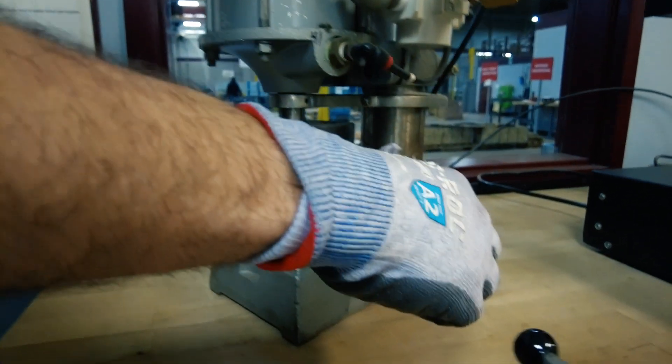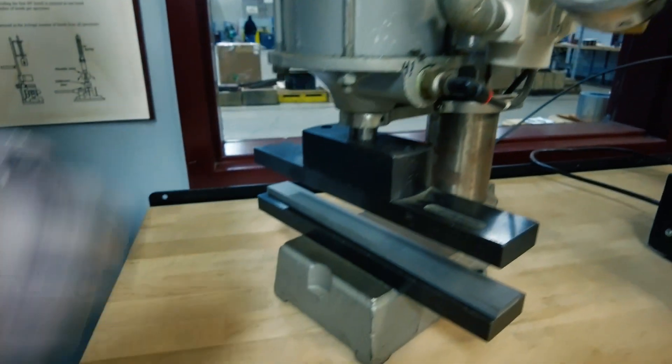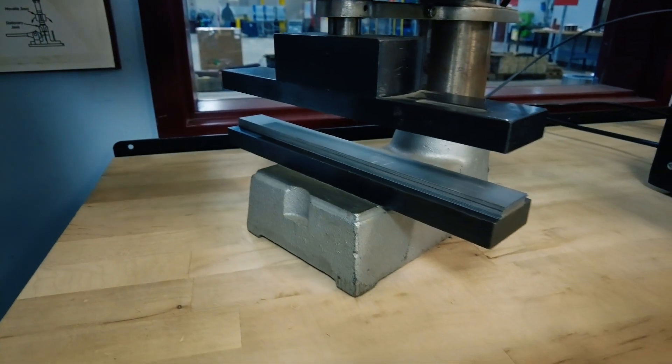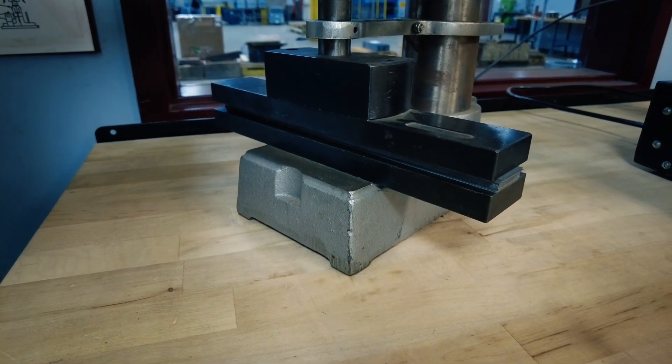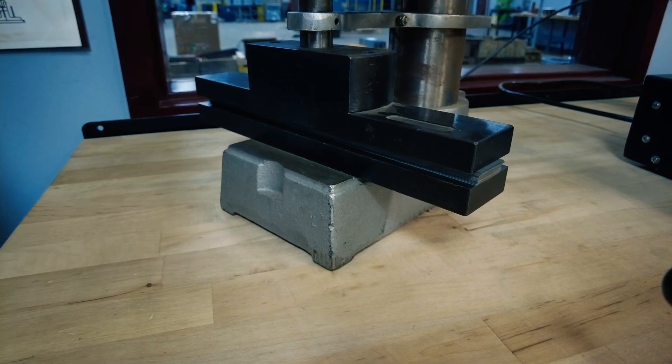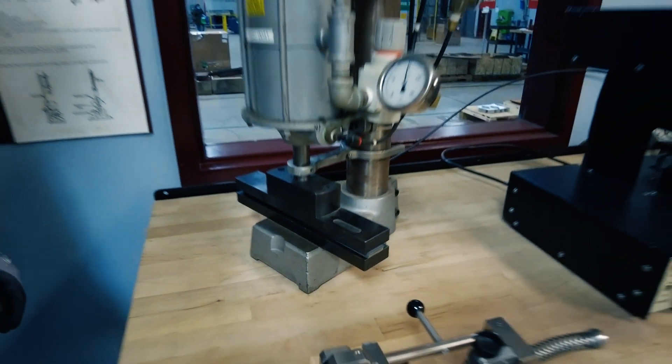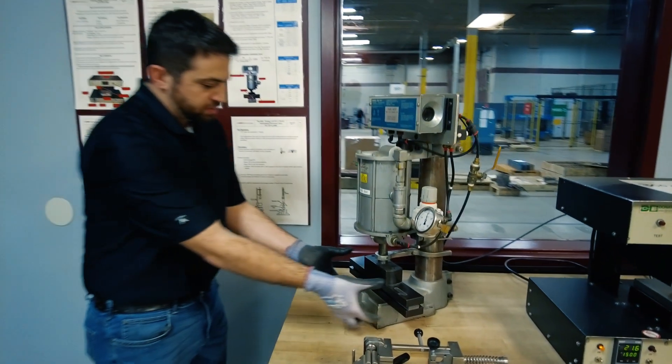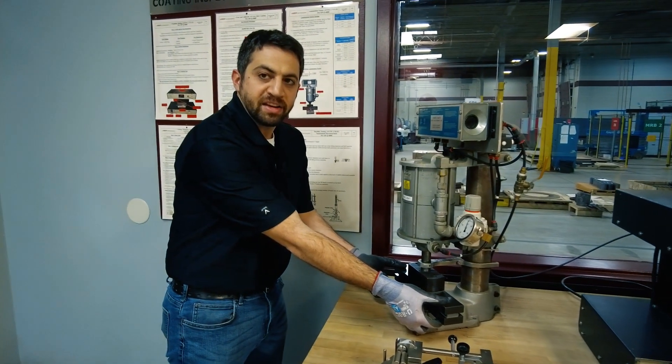We'll place them in this press at a known pressure, apply the pressure, let it sit there for the designated amount of time, and take measurements as far as what the stack height is.